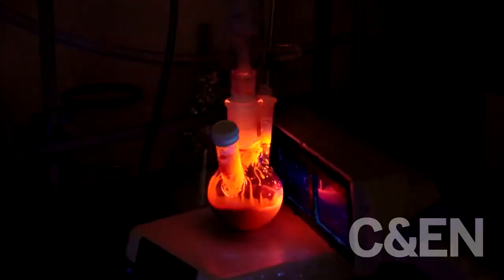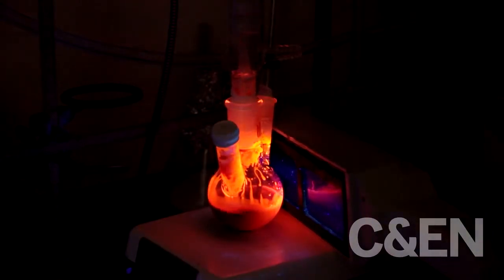So at this point, the reaction is over. So if I excite them with the black light, you can see that now they fluoresce. At the lower temperatures, we're able to see the color much more clearly.